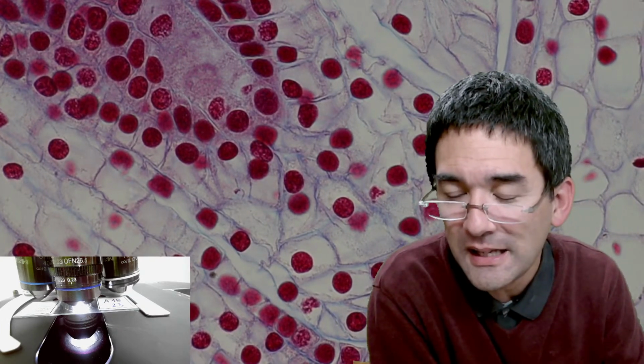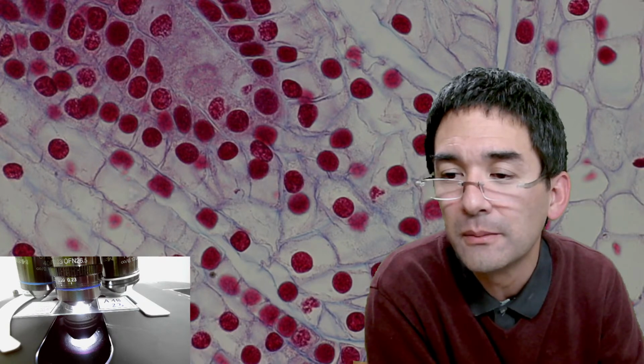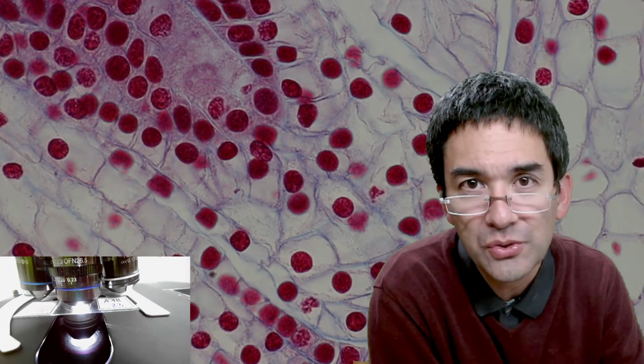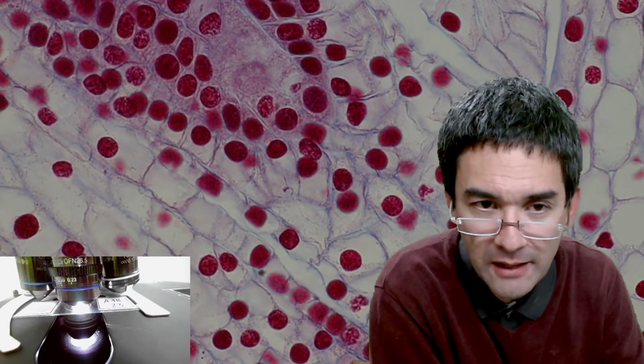If carmine acetate stains DNA, does it also make mitochondria and other DNA-carrying organelles visible? I guess it should. I just wonder if the concentration of DNA in the mitochondria is high enough for you to see it. Okay. So that's a little bit the question that I have.